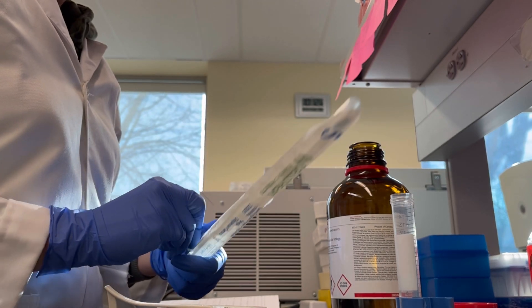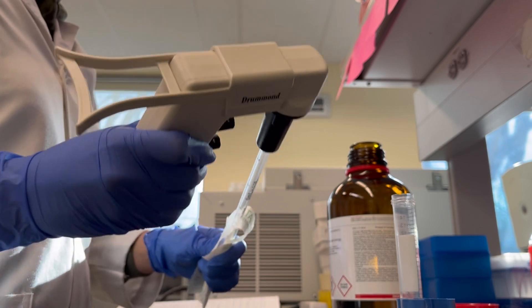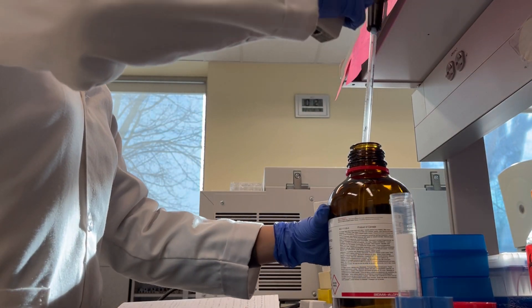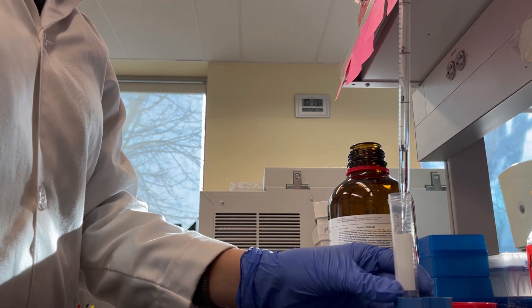Add 500 microliters isopropanol, also known as 2-propanol. Then shake it gently for 10 times and incubate it at room temperature for 10 minutes.